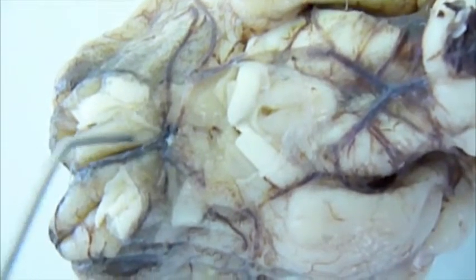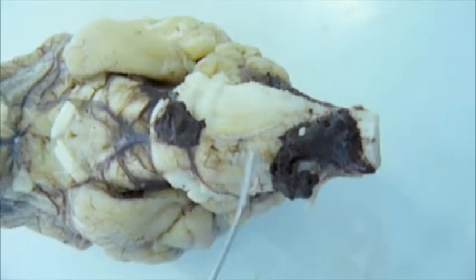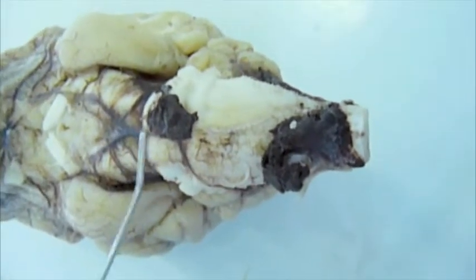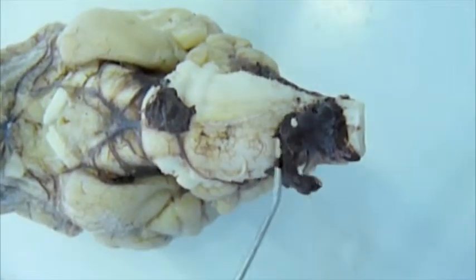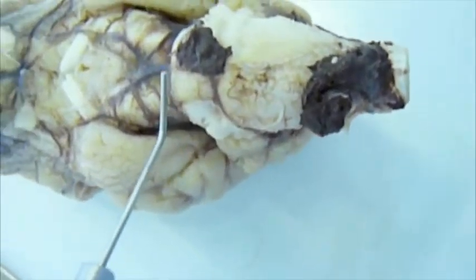And then we have the rostral cerebral artery, which we can't really see, but it should be right along here. The basilar artery is what runs up to the circle. You can't see it very well on yours, but actually you can. It's the second bit. It runs right up into here.